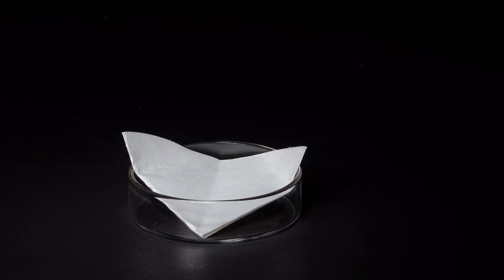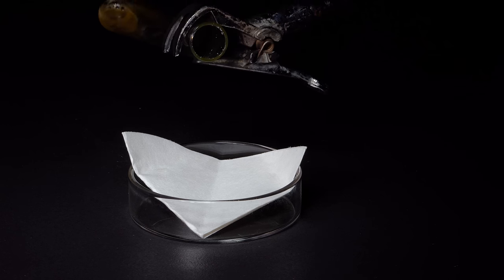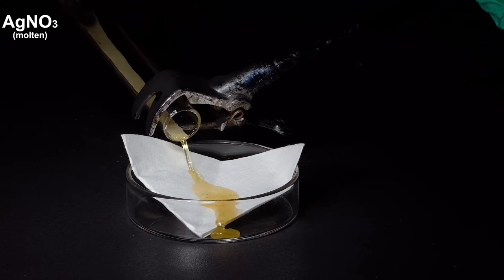By the way, if you need to set filter paper on fire, you can use molten silver nitrate. It will do the job fairly quickly.